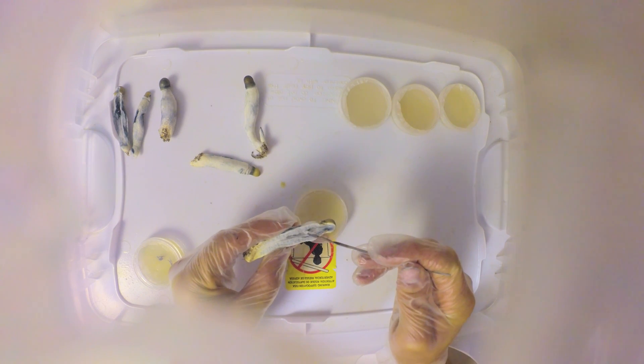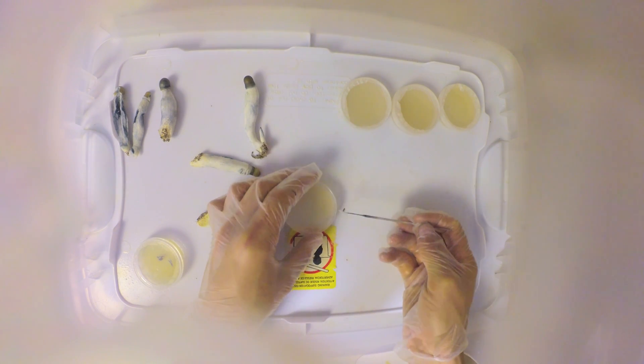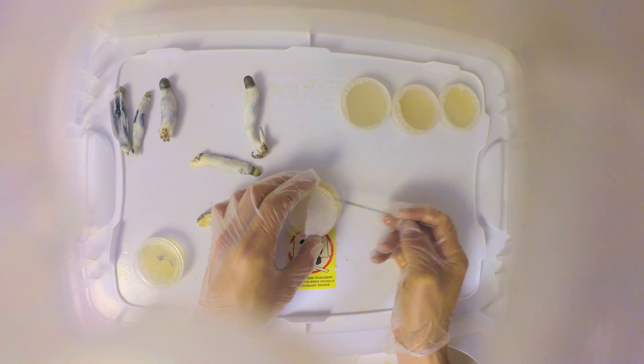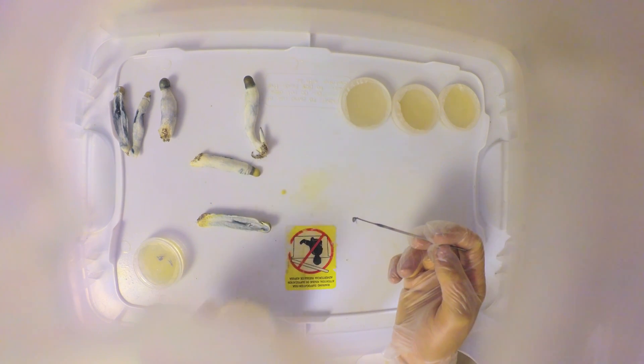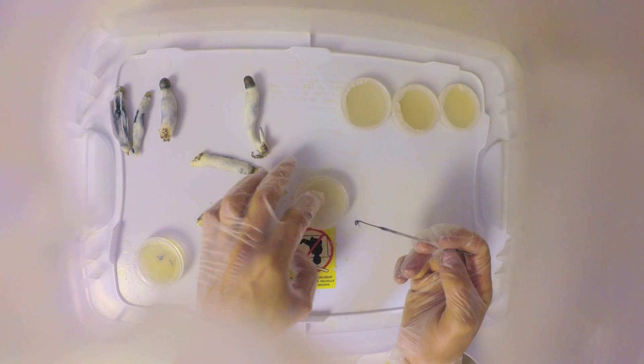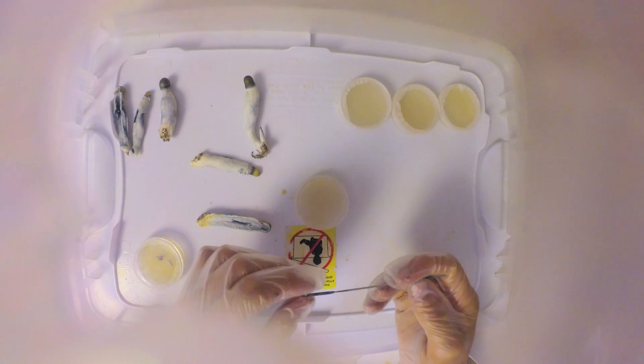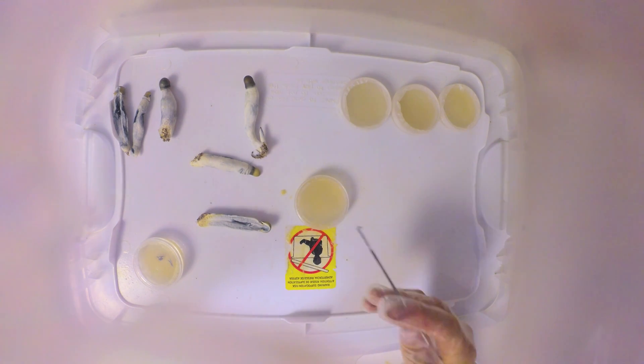Cool it down in the mushroom, take a little bit, you don't need much, and just place it in there. In that case I'm going to re-sterilize this and then rip open the mushroom a little bit more and harvest from a different part.